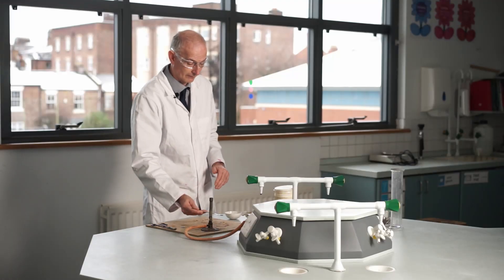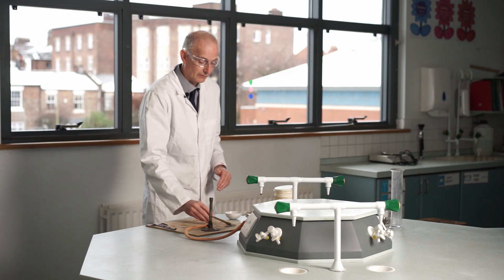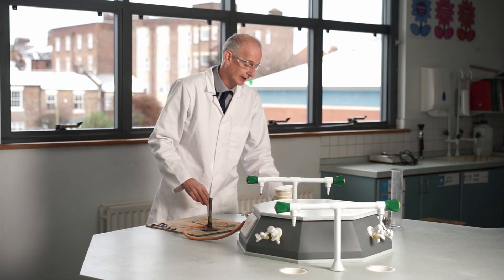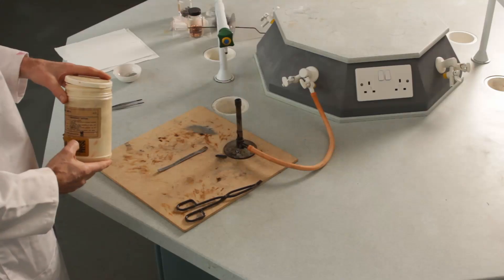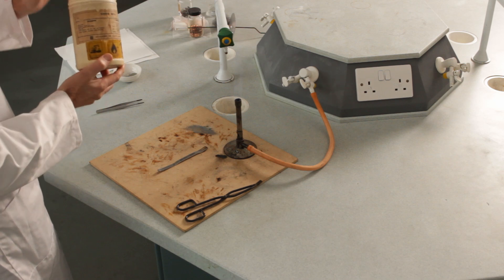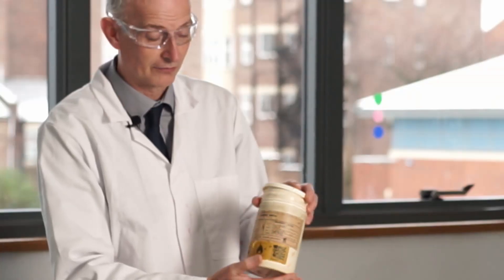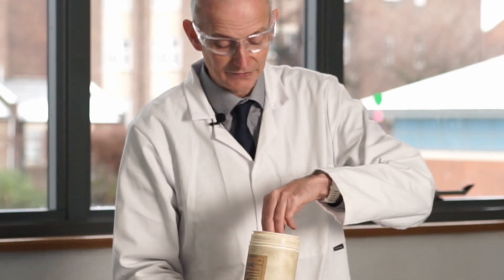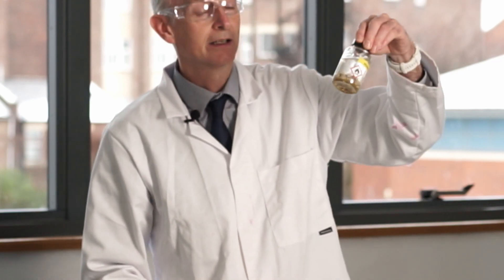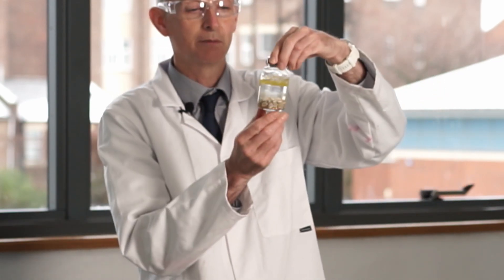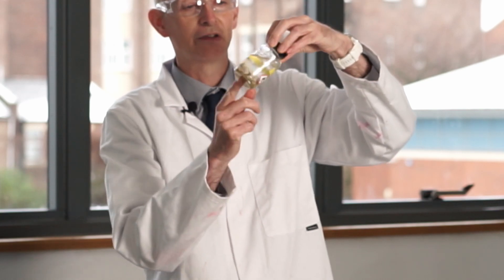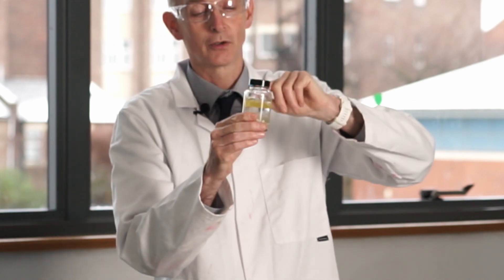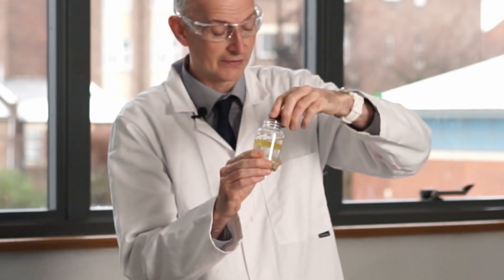That's zinc. Now we've got some sodium here for you. Sodium is a peculiar metal—you don't come across it very often. It's stored in a plastic vessel with lots of hazards on it: corrosive, flammable, explosive. This is why you don't come across sodium very often. Inside the plastic tub is a glass tub, and the sodium is sitting in chunks at the bottom of this liquid—this liquid is oil.